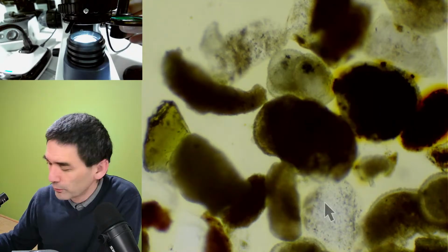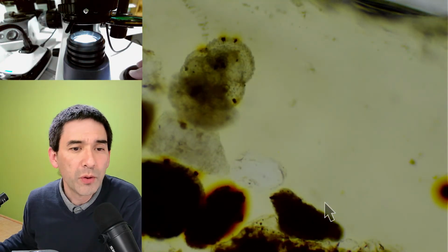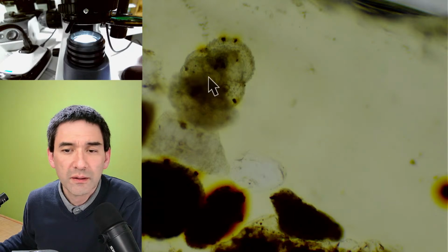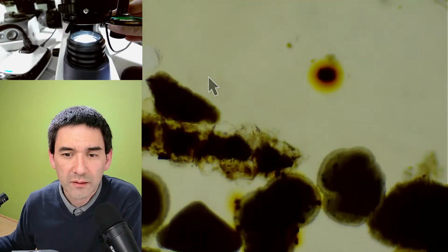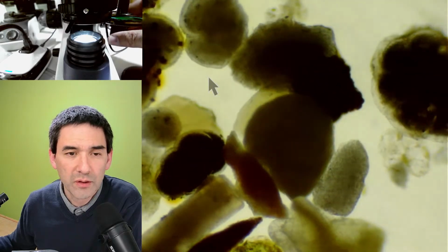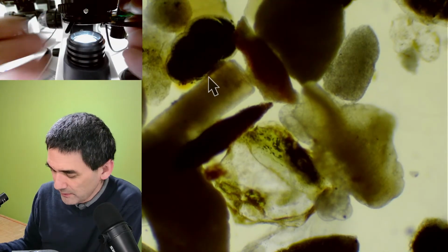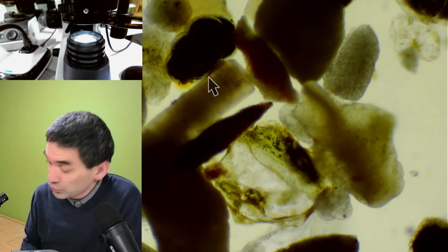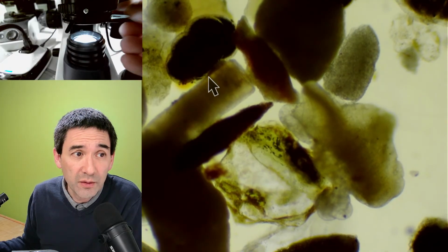By the way, this is a commercial sample that I have here. Yeah. Or this one over here possibly. So you have to kind of look a little bit. But let's see again if I'm able. Honestly, I have not tried oblique illumination or anything like this on this sample here.